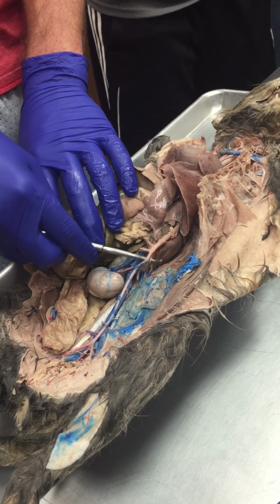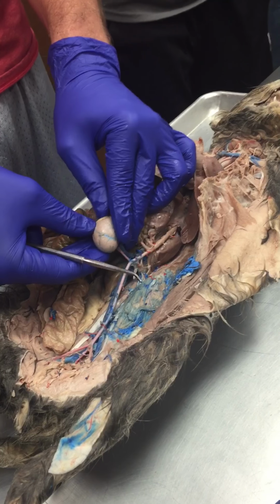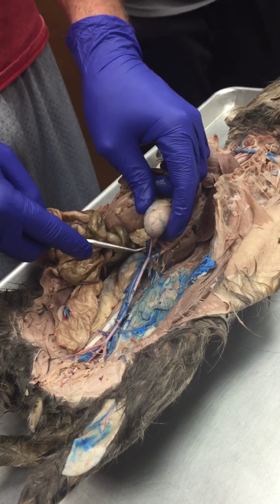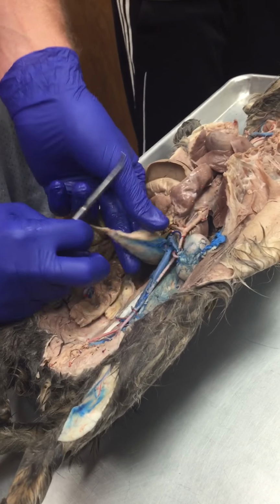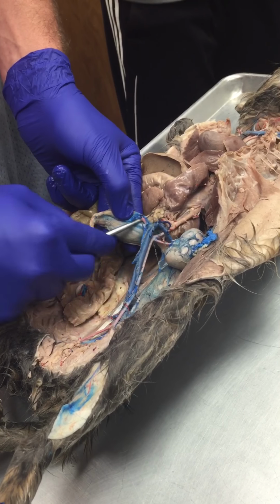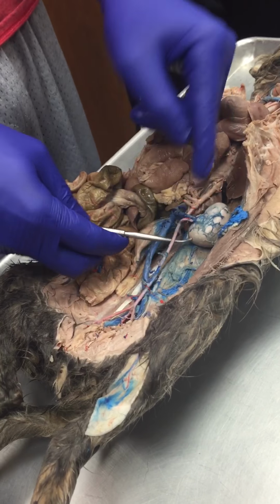We'll keep traveling down the aorta, and then we'll see some vessels come off to this kidney, and anything to do with the kidney is going to be renal. Okay, so we have a renal artery coming off to each side. So that's one right there, and it'll do the exact same thing on the other side. We'll see a renal artery right there. All right, so those are to the kidneys.